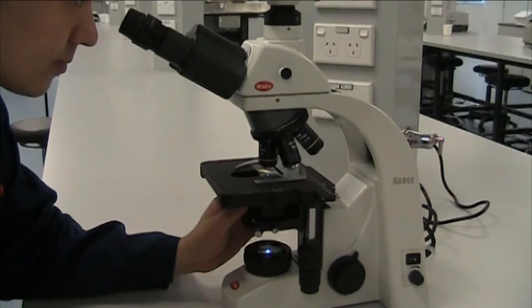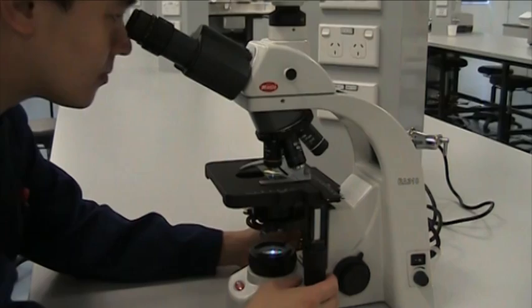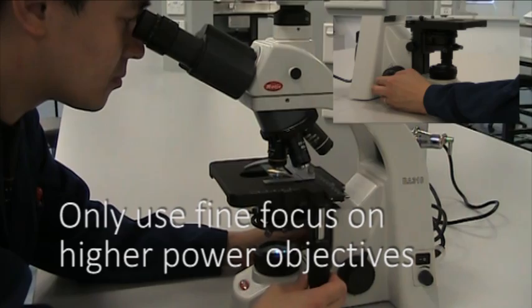Because these microscopes are parfocal, when you move between objectives the specimen should stay mostly in focus. You should only need to use the fine focus to bring your specimen into focus.